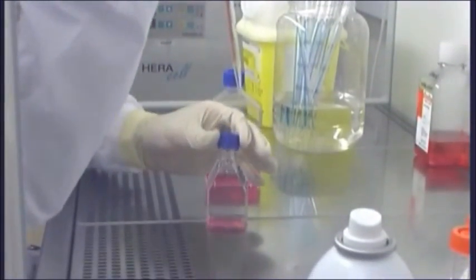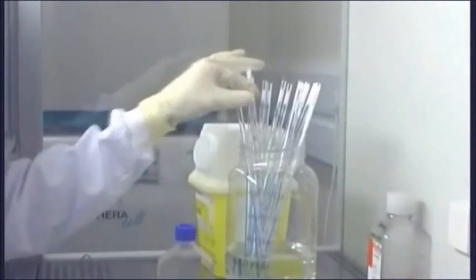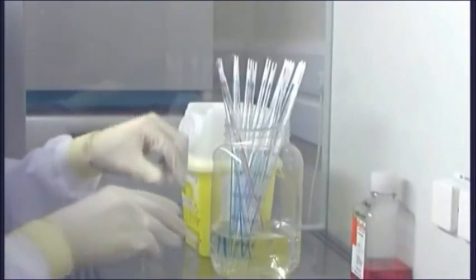Waste liquid accumulated in the safety cabinet during routine culture can be a source of contaminants and should be disposed of after each session.